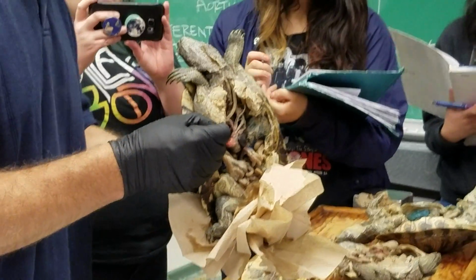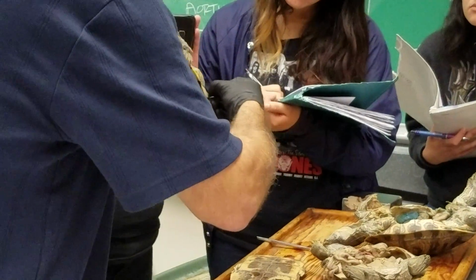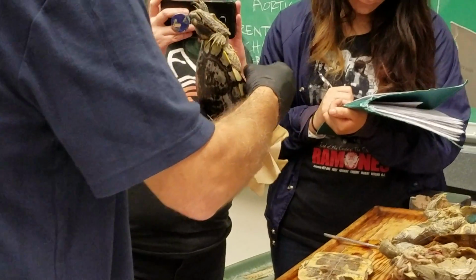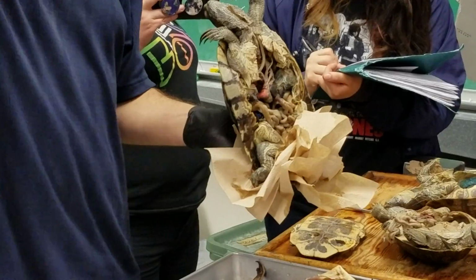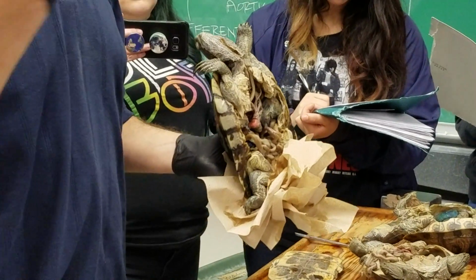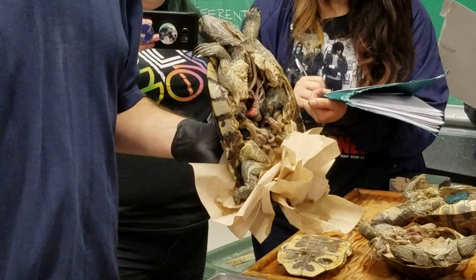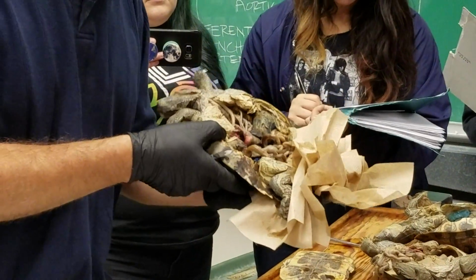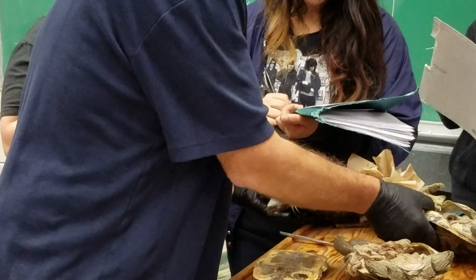And so that right systemic trunk gives rise to the right systemic arch going around the body, as well as the brachiocephalic supplying the head and the forelimbs. Okay, and that's that asymmetry. So on the left side, it's just the left systemic arch going off. On the right side, the right systemic arch plus the brachiocephalic going to the forelimbs and the head. Okay, and that's just the way reptiles do it. Kind of strange.